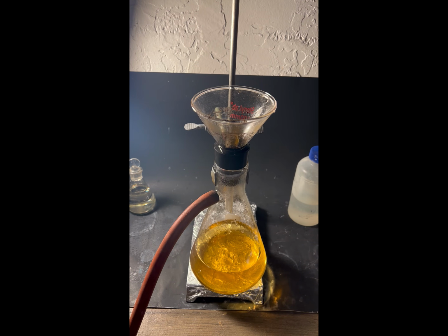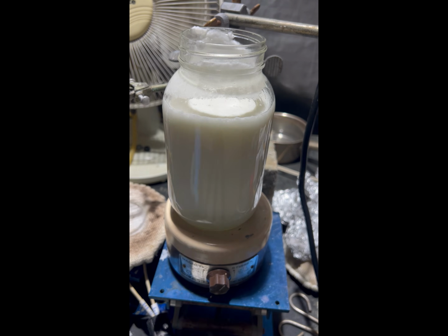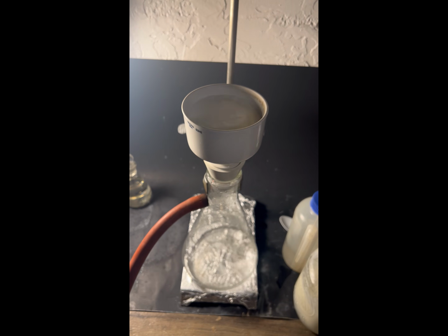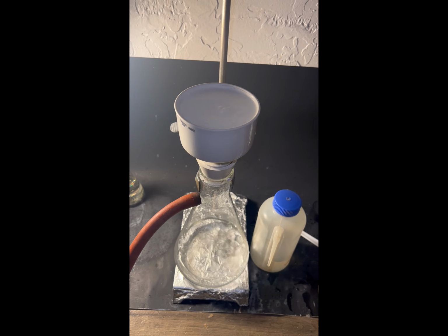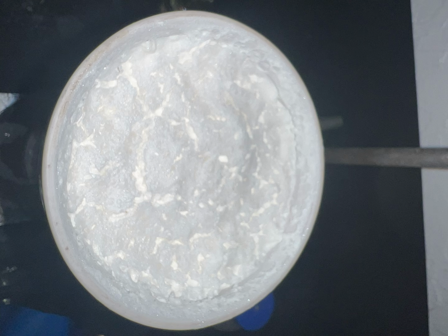After the filtration, the filtrate was acidified with an arbitrary amount of 10 molar hydrochloric acid until I felt like all of the benzoic acid had precipitated. Then I filtered it again, washed it with water, and dried the product with mild heating. If benzoic acid wasn't readily available to me as sodium benzoate, I would have purified this further.